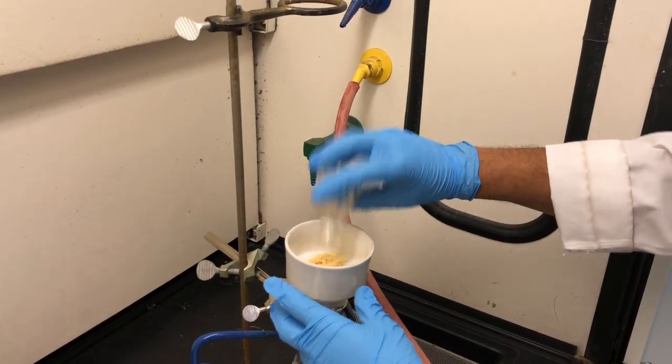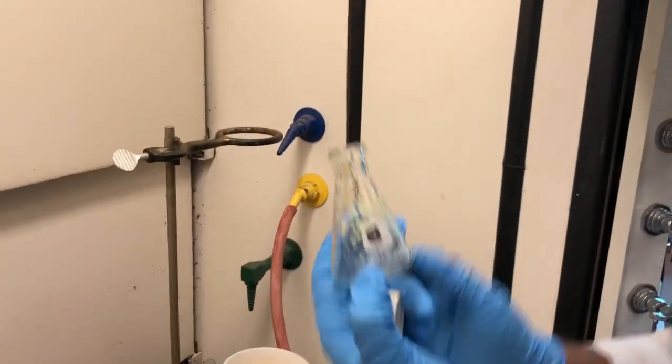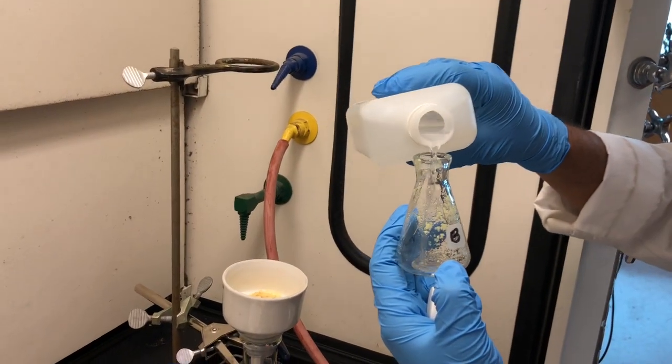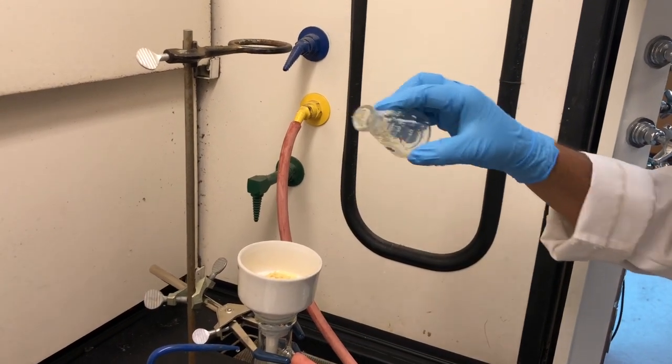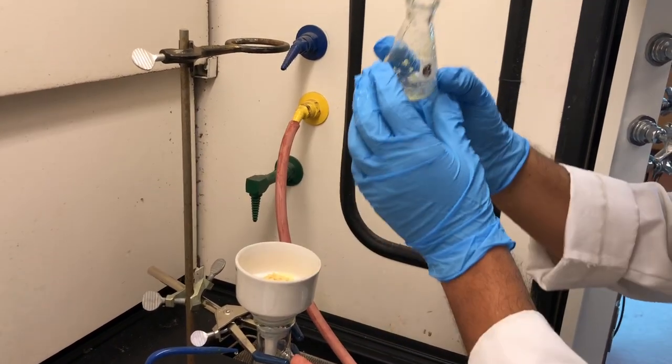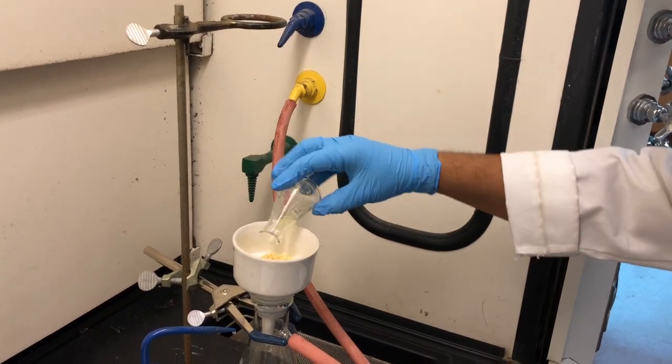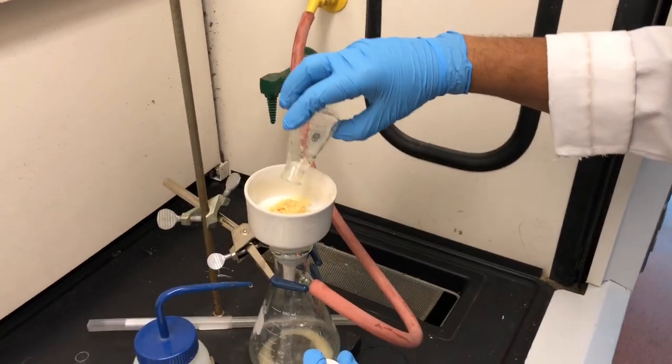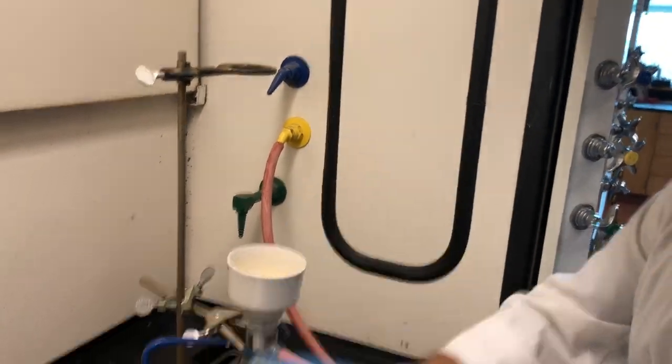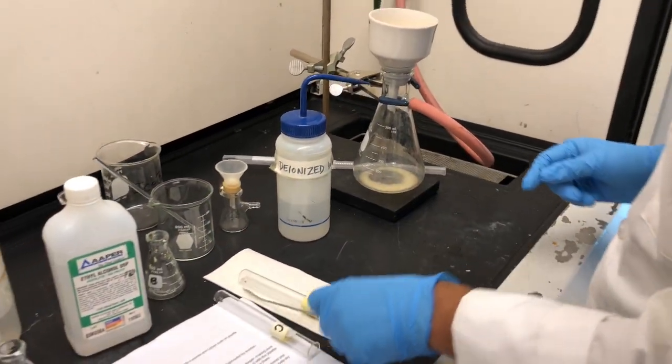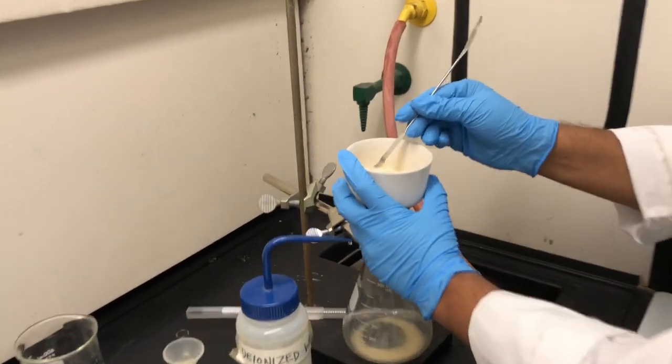You will notice that I still have some solid left. Maybe I can rinse one more time, just to make sure I take out the maximum. You will notice there are still few particles left, but that's completely fine. You don't need to fight to take out every particle.